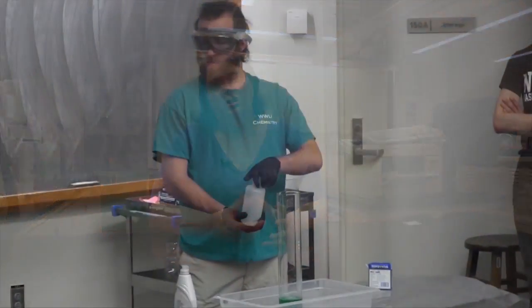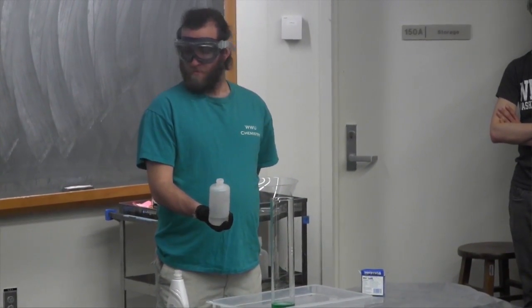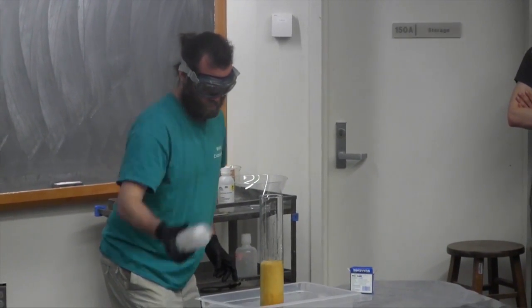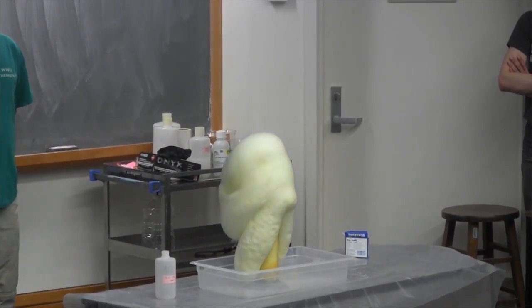So hydrogen peroxide naturally decomposes into water and oxygen gas. And that happens pretty slowly on an everyday basis. If you let hydrogen peroxide sit there, you might see a few bubbles now and again, but not very many. And so we actually sped that up by adding a catalyst. So we added potassium iodide, which causes that reaction to happen much faster. And to visualize that, to actually see the gas being produced, we added a whole bunch of soap. And so it produced this cascading, just giant volumes of foam.